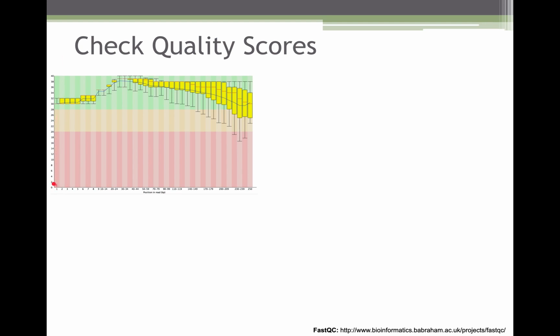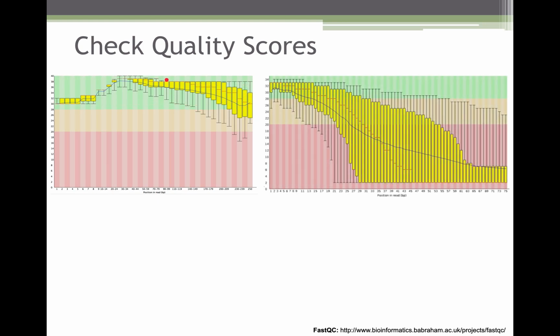As I told you, the quality scores go from lowest to highest here. Anything below a quality score of 20 is not considered very good quality, between 20 and let's say 28 is okay quality, and anything above 28 is really great quality. The plot is also color coded, and in this particular example you can see most of our bases are in this green region, which represents good quality data, as opposed to this sequence data where you have lots of bases dropping below a quality value of 20.